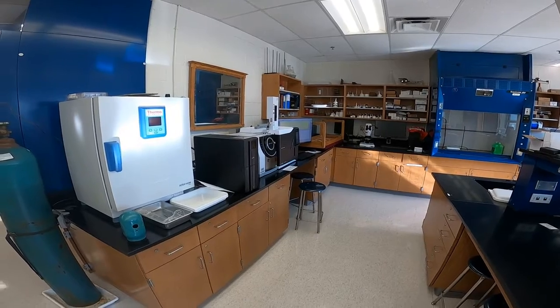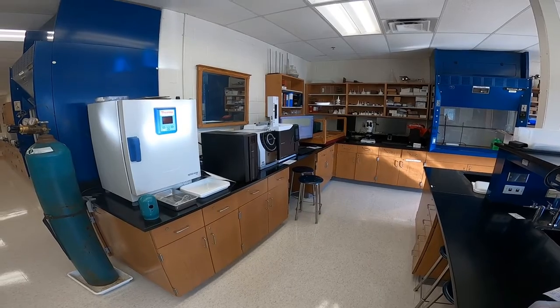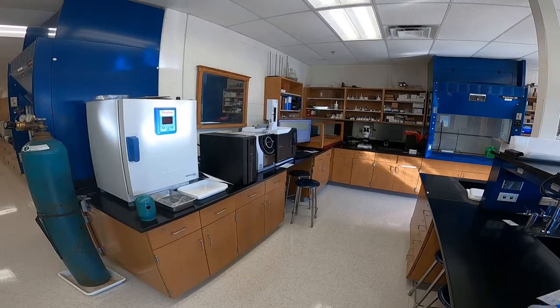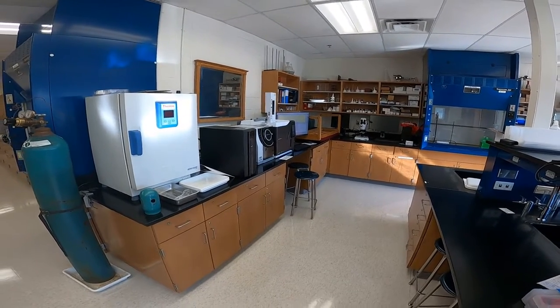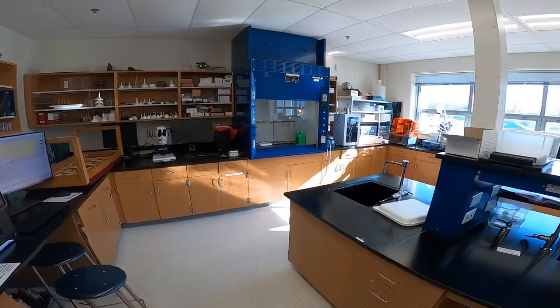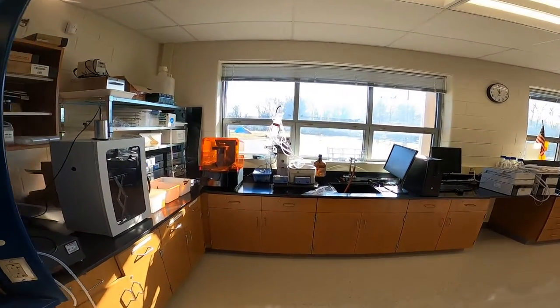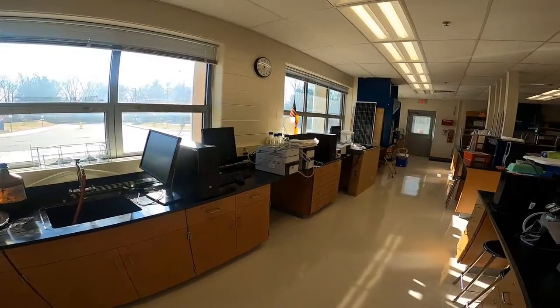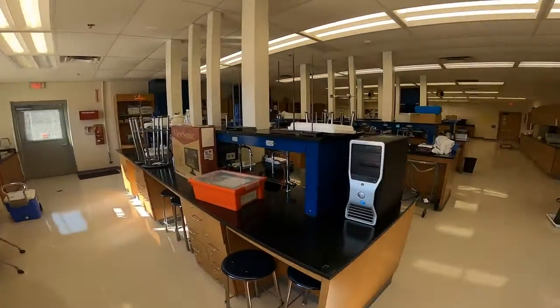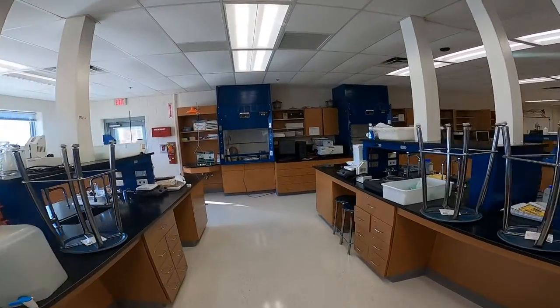A primary tool in a standard high-level chemistry lab such as this one is what's called a gas chromatograph mass spectrometer. With this you can determine molecular structure of unknown compounds or analyze mixtures. Also in the lab we have a 3D printer and a variety of other lab equipment such as a rotovap for distillation. We have what's called a liquid chromatograph and UV vis spectrometers, many different lab stations for doing lab work and fume hoods for doing more complicated lab work or hazardous lab work.